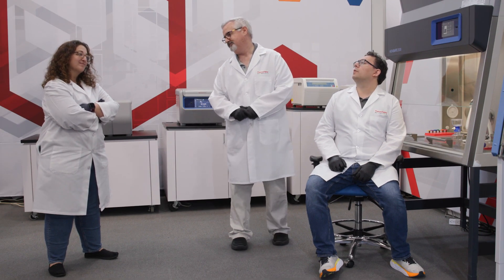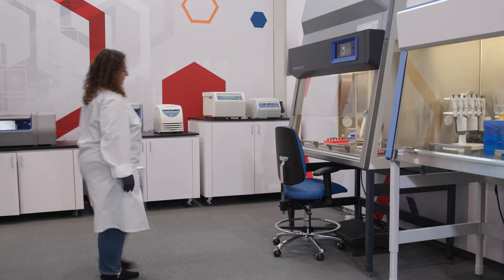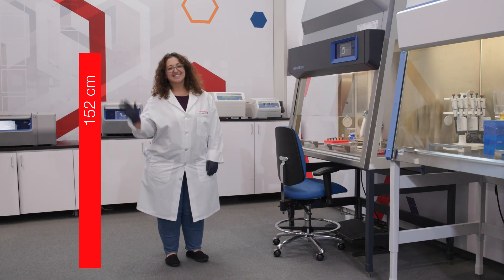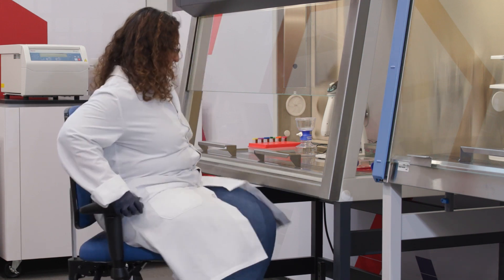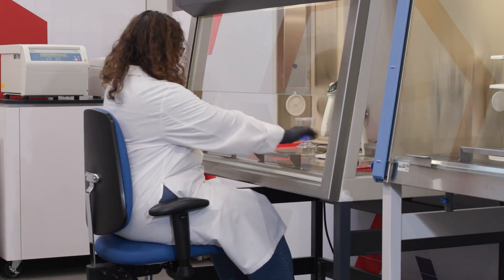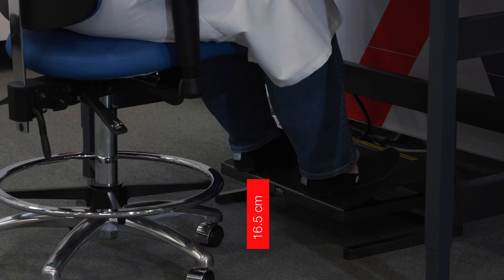Another thing we love about science is how our world becomes more inclusive. Michelle is about 152 centimeters tall, which is about the fifth percentile for height in ISO 7250-3. This is perhaps an extreme situation with individuals at both ends of the height range working in the same cabinet. With the cabinet set for Aaron, we will need to raise the footrest to 16.5 centimeters.